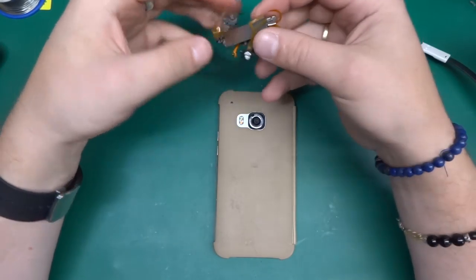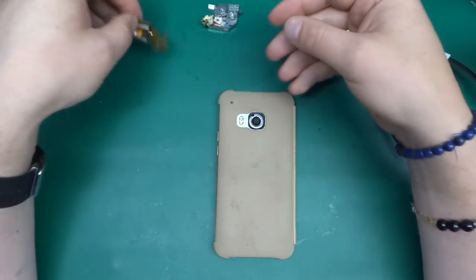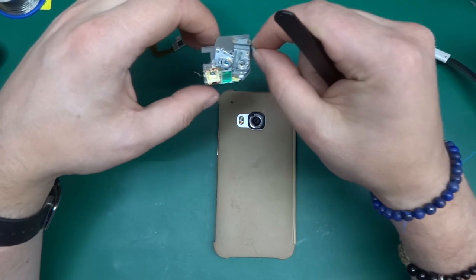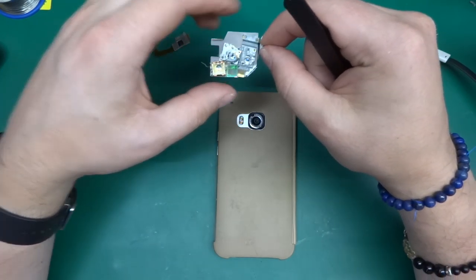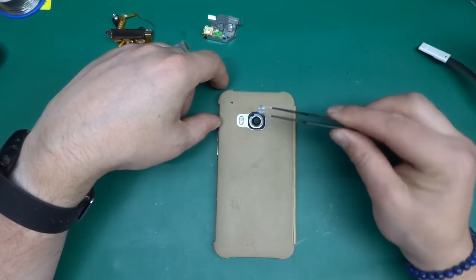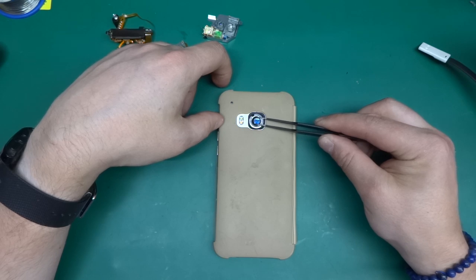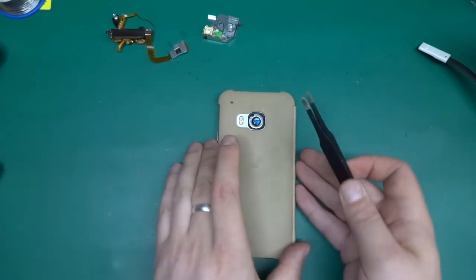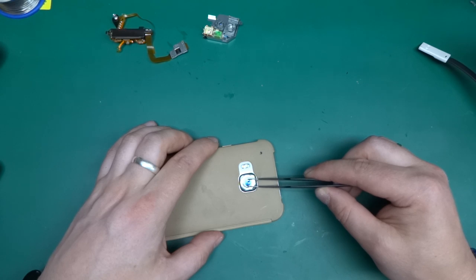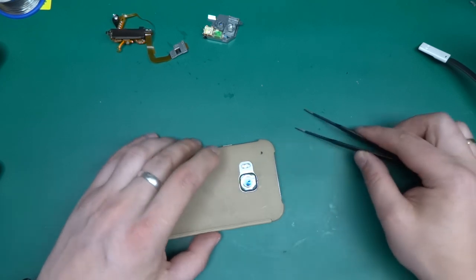Okay, so I tidied up a little bit. We've got the bits and bobs that we pulled off, including this interesting looking chip. A tray worth of optical stuff, including two laser diodes. But the main thing I was after in this is this lens. So this lens you have to place on the back of your mobile phone, just so it is in the center where your actual phone lens is. It doesn't have to be perfectly centered, but it always helps to be somewhat precise.